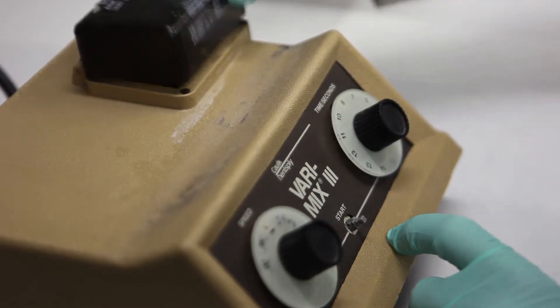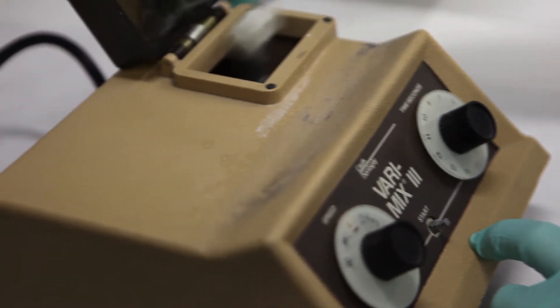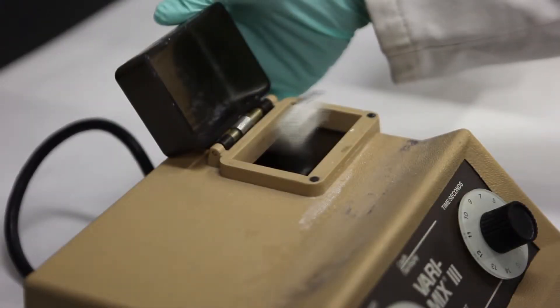Now we open this up, you can see what's happening. Now at this point in time, the acrylic BBs are pulverizing the barite and the other soft minerals that are in this sample.